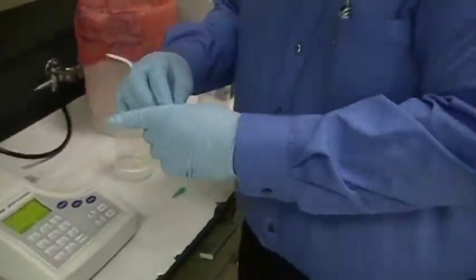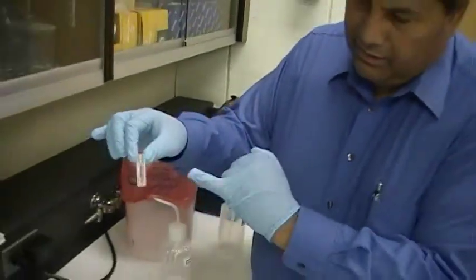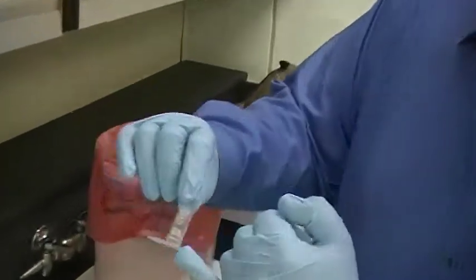Now, usually when you are holding this cuvette, you should hold it on the side. These are the windows that are on the side and they are not very clear on that side, but this is clear, very narrow path which is front and back right here. So always hold it on this side and before you start using it, wipe it down with a kim wipe.